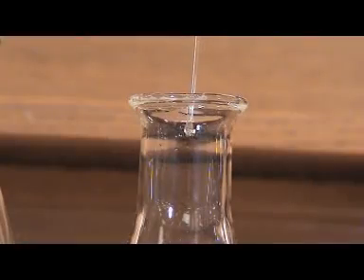You can see most of the solid is now in solution. We just need to add a small amount more of the hot solvent but be careful not to add too much.